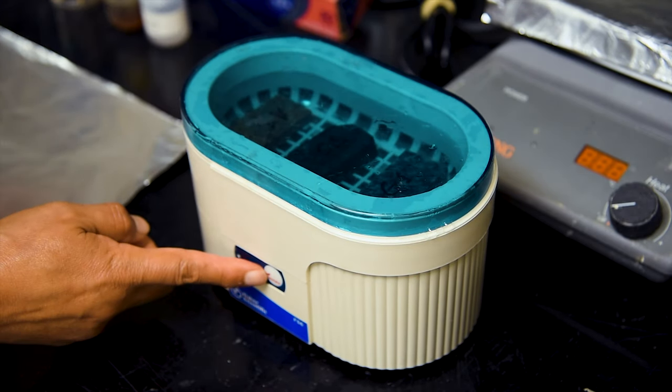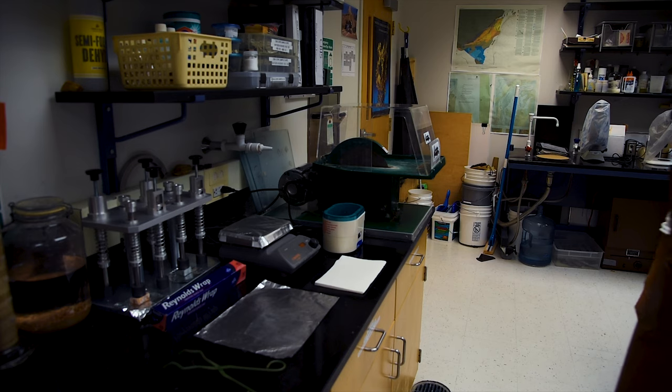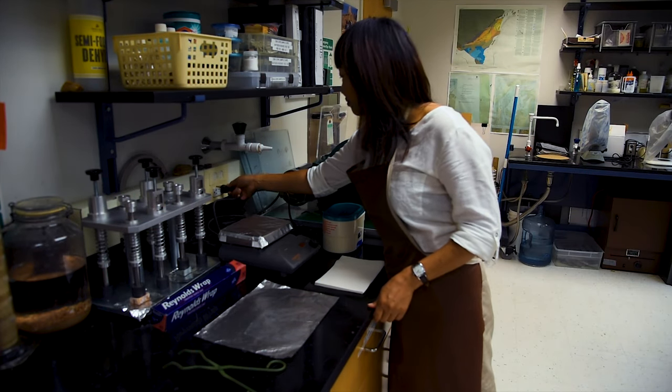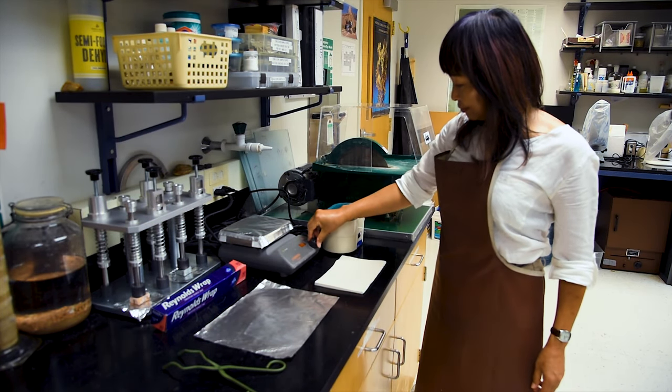Once the ultrasonic cleaner is turned on, it will run for a few minutes and shut off automatically when it is complete. While waiting for the ultrasonic cleaner to finish, this is a good time to set up the hot plate and the materials needed to epoxy the sample chips to the frosted slides.